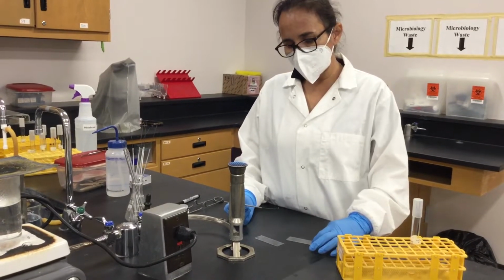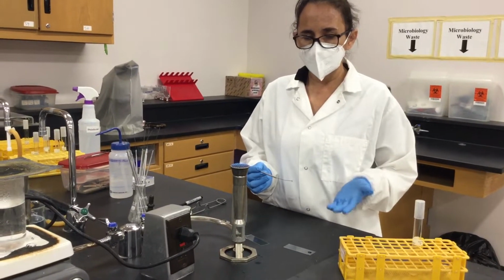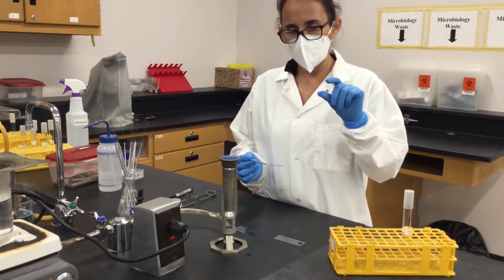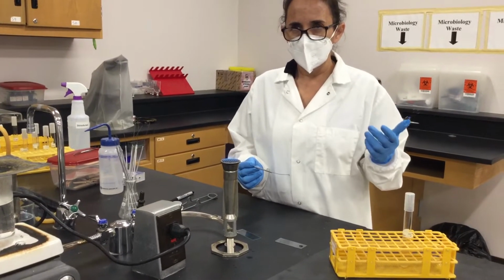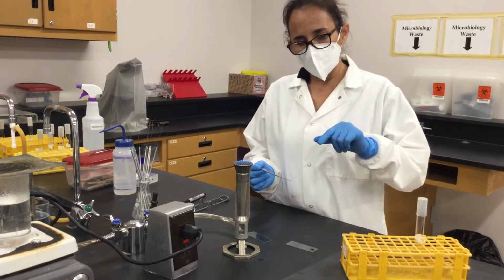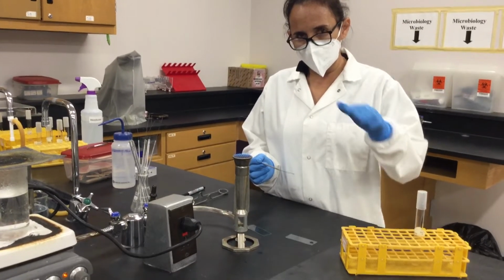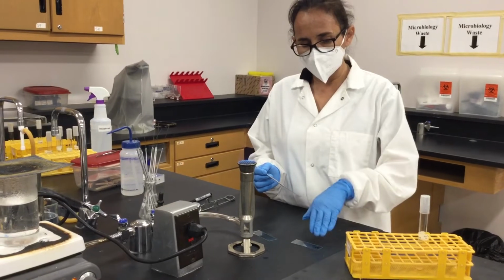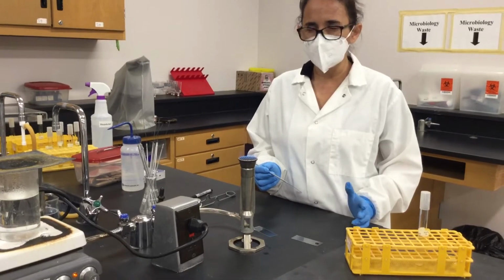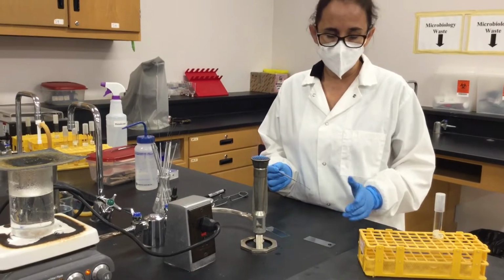And some things that you can see while I wait for this to cool off is just as for the negative stain. When a bacteria has a capsule, which is the outer layer that it's outside of the wall, which is made out of carbohydrates mainly, you will expect to see a white area around the bacteria, and the background is going to be stained. In this case, since it's Congo red, it's going to be stained red in color. But if you use something like nigrosine, you will see the area dark around the bacteria.